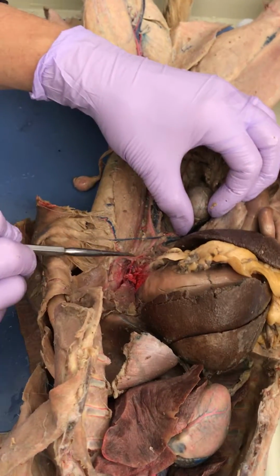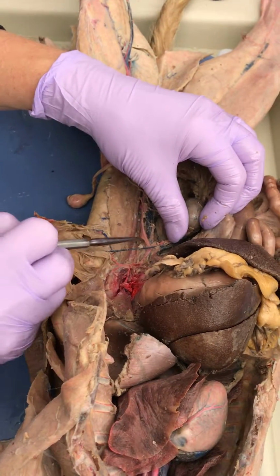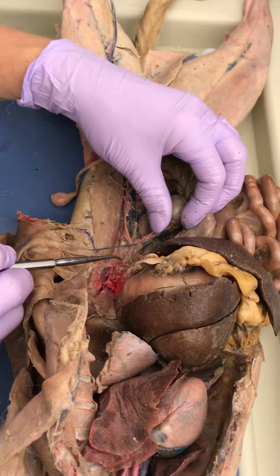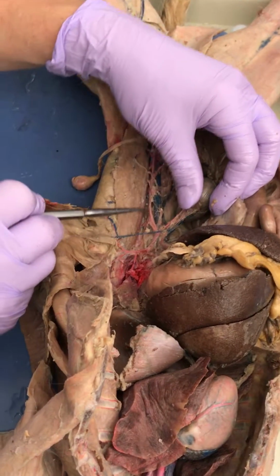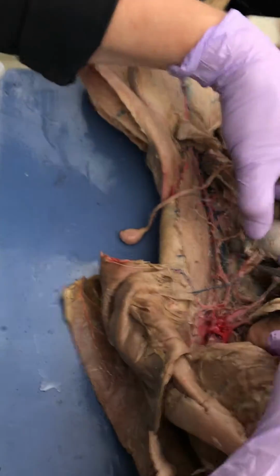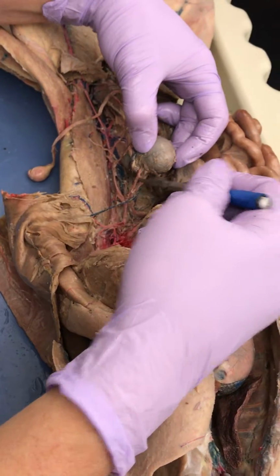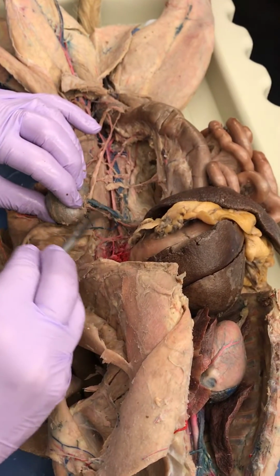Okay, I'm just cleaning up a little here because, like Harley said a minute ago, we have to know the aorta all the way down the body. So I'm just making sure you guys can see that's still the aorta. Just following the aorta right there. Okay, coming off the aorta right here, renal artery, and then the renal vein.